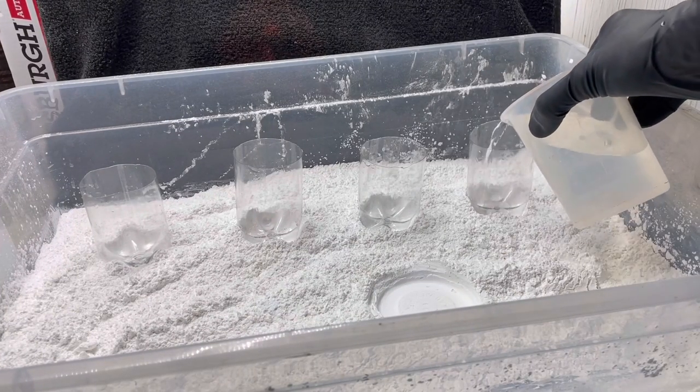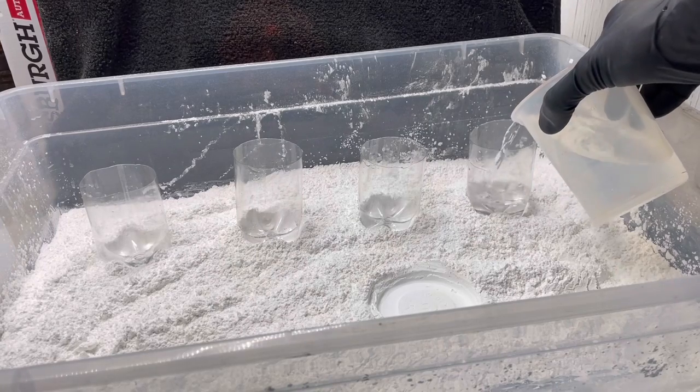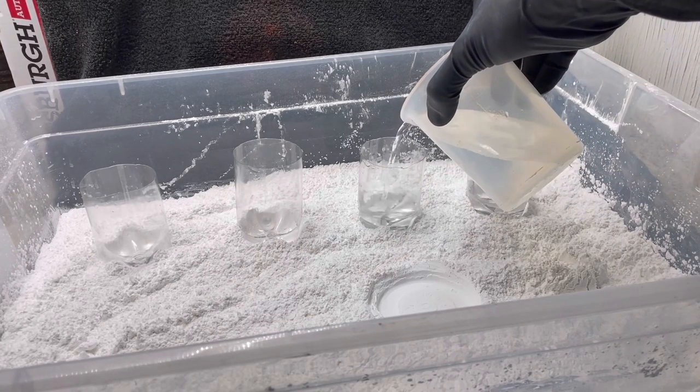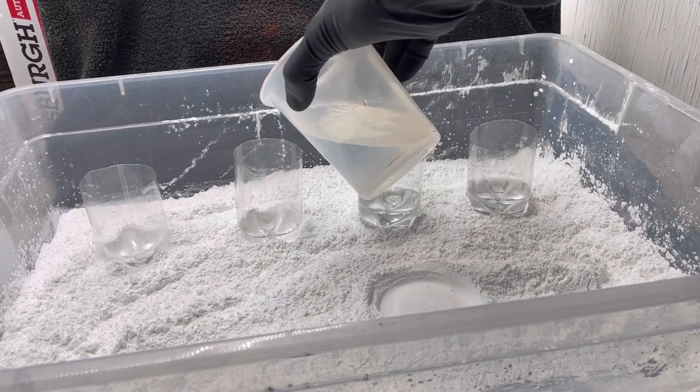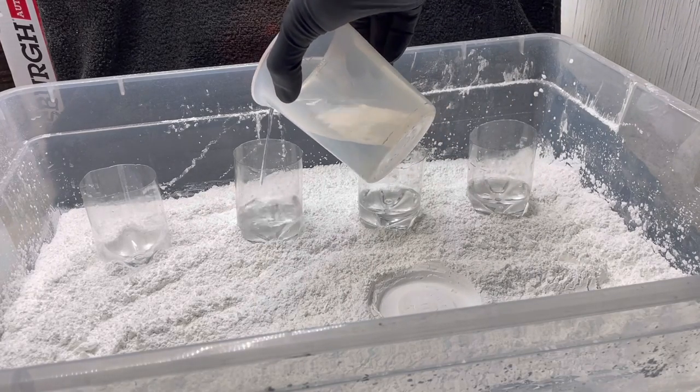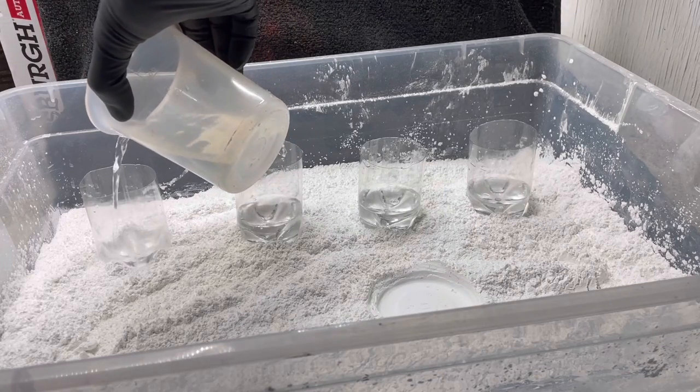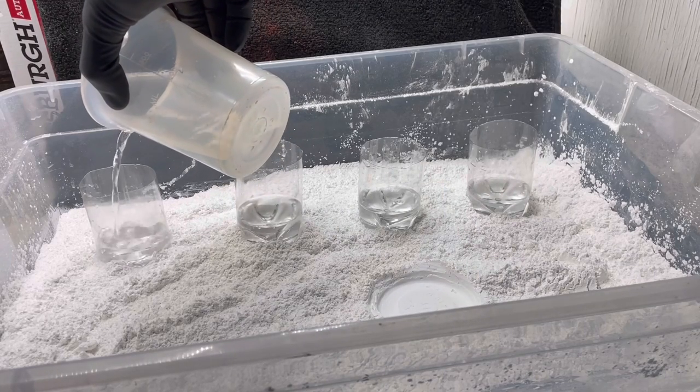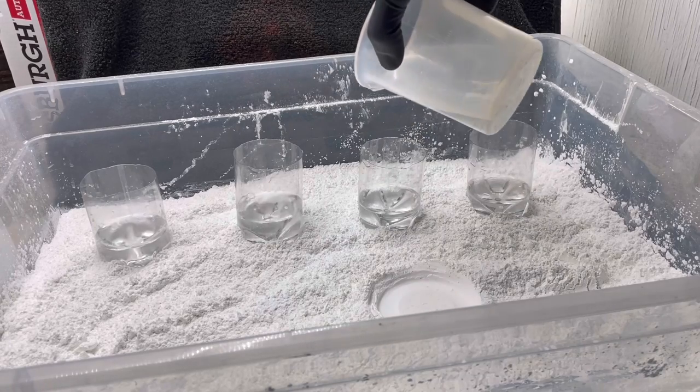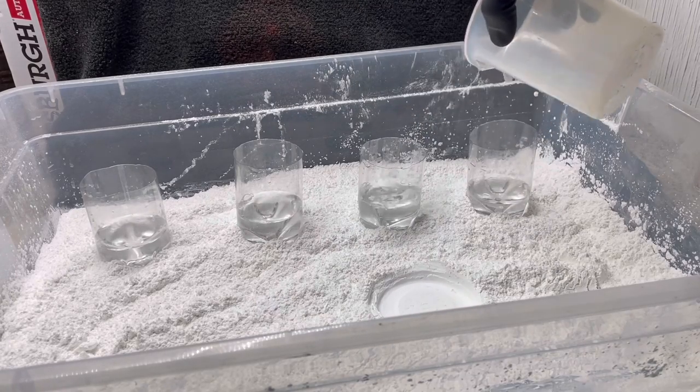Alright, lets just transfer some of this into these soda cups, soda bottle cups, I guess. Plastic of course holds up to the acid much better than any glass beaker would.